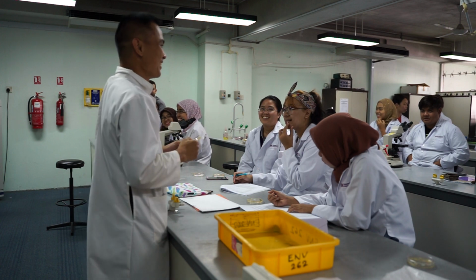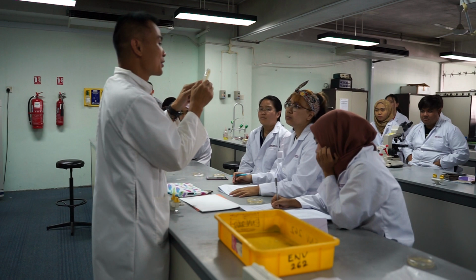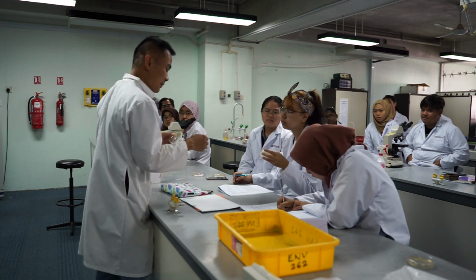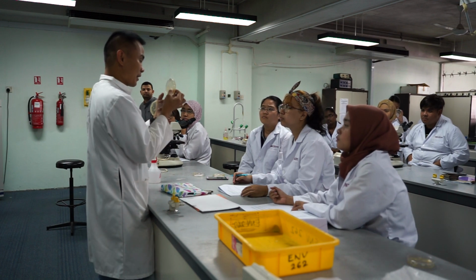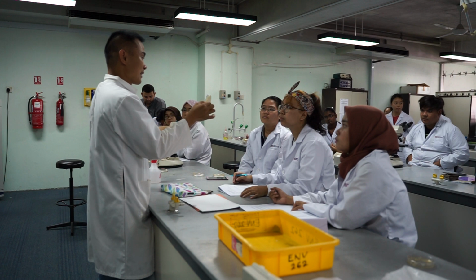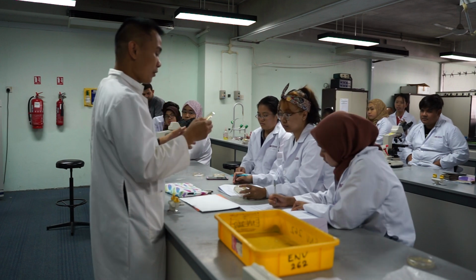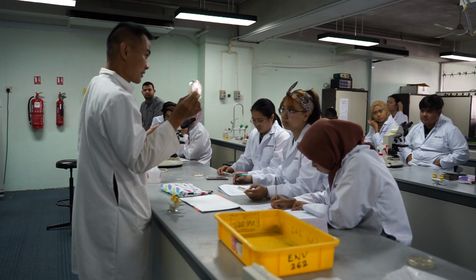Zarif. Okay. So if it is a mixture of species, before you know what they are, you need to isolate them. Basically, you make them single species. Because it might be a mixture. Some of them are mixture. Like this, for instance, if you see like that one, how are you going to split them? But you're lucky now because they are basically split. But if you leave this on to grow, it will combine. Okay. But then, if you want to identify them, you need to turn them into one single species.